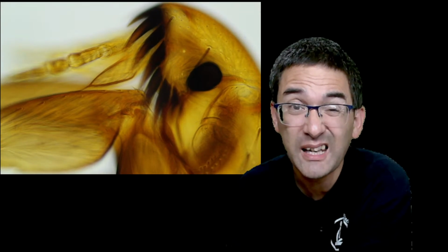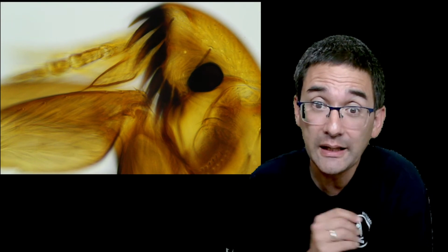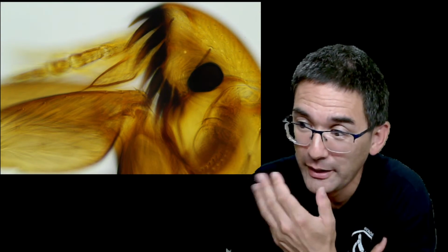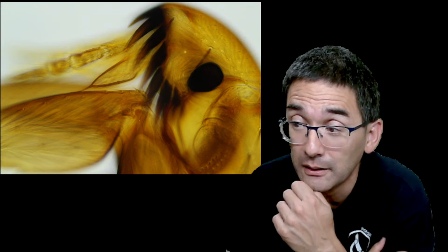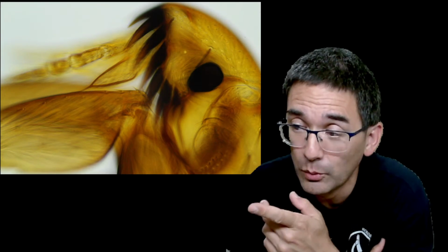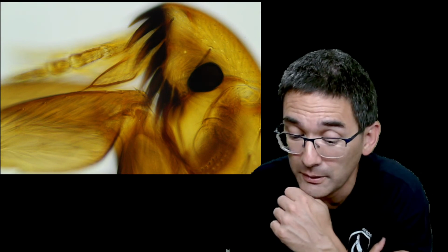Disadvantage, kind of expensive. Second disadvantage, and that's what I really don't get, is the company does not make this. I mean, the microscope is really ideal for that. All you have to do is add a metal tube, and that's it. So I wrote them an email and said, please have a look at this, with a link to my video where I showed them how I 3D printed this. But that is indeed a possibility.